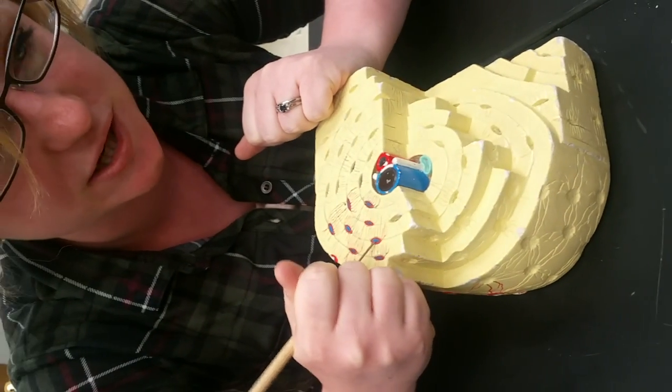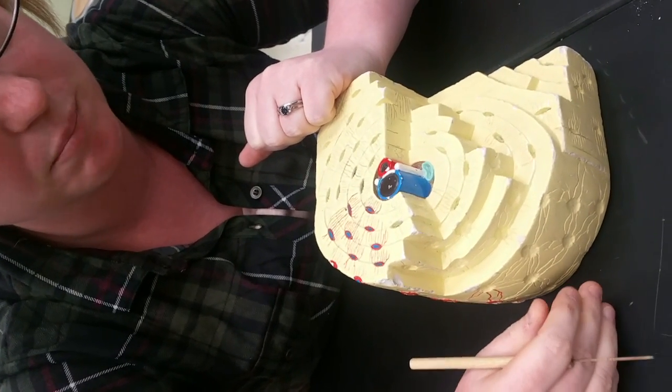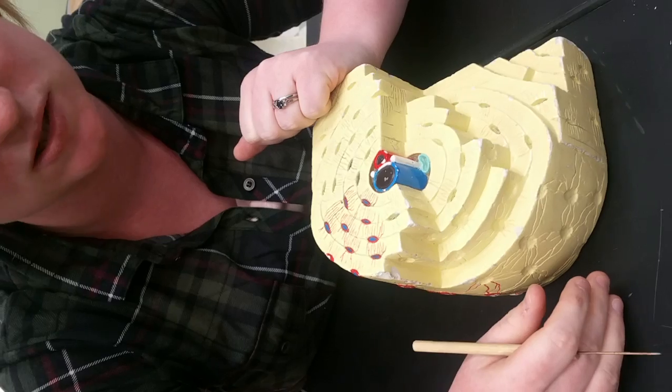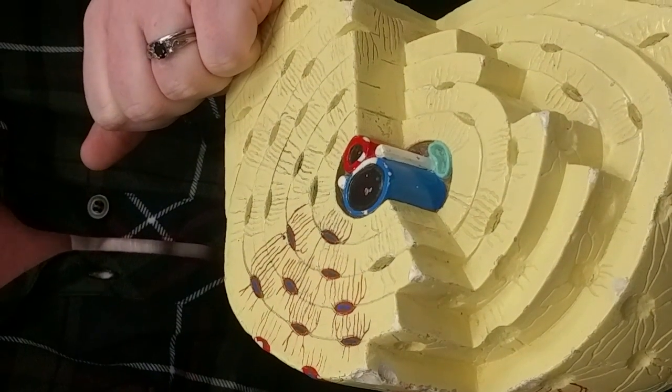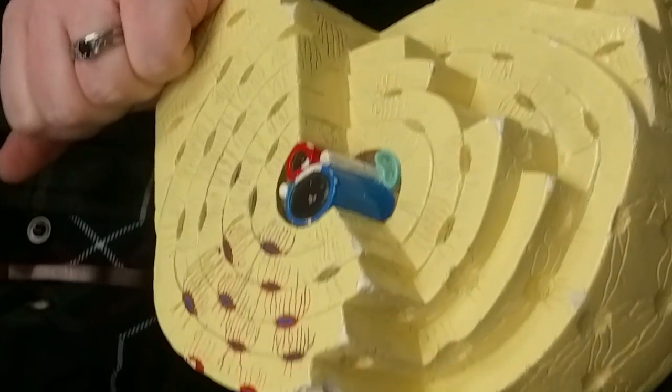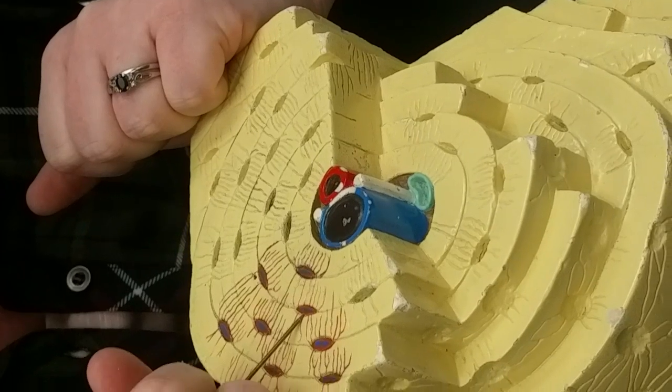They're called osteocytes. So whenever you hear osteo, you should immediately think of bone and bone tissue, like osteoporosis, right? Osteoporosis is a weakening of the bones. The bone itself becomes porous. So osteo always means bone. Osteo, bone, cyte, cell. There you go, okay?